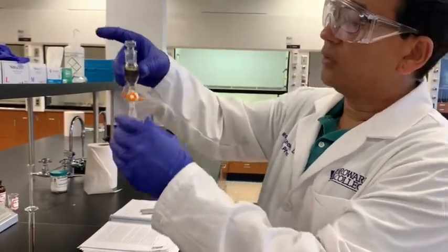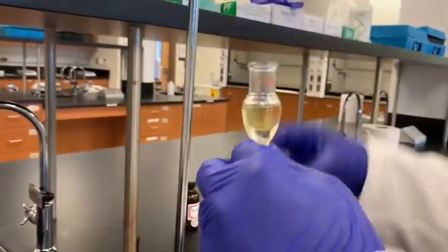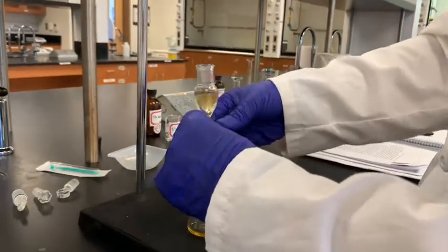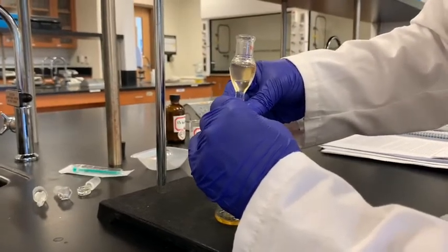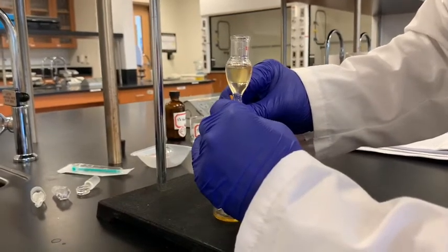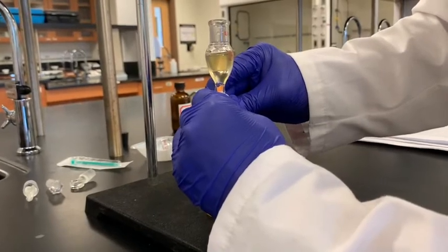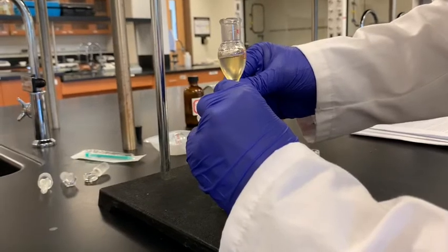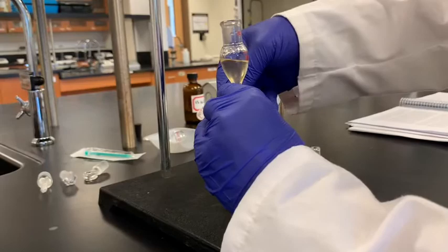All right. Now this lower layer again is the aqueous layer. That is what we don't need. So I will put the aqueous layer together in this previous aqueous layer, we mix them together. So that I will draw the aqueous layer. Looks like it is good.